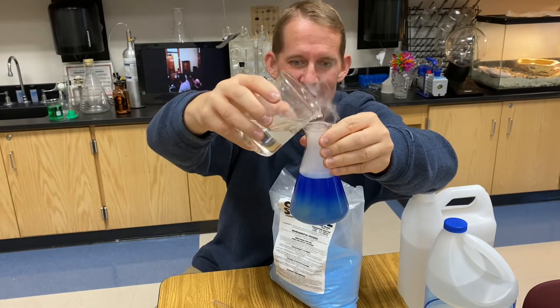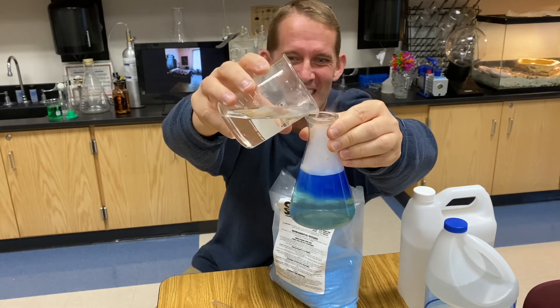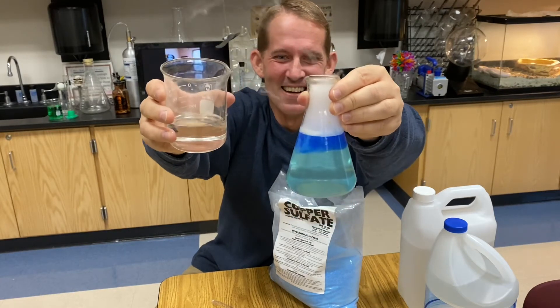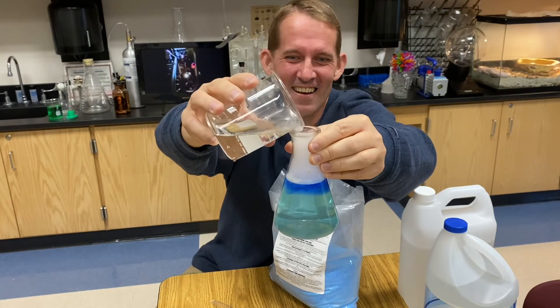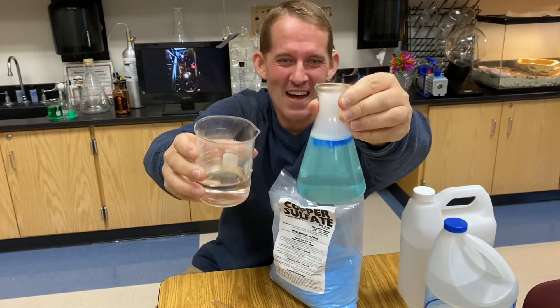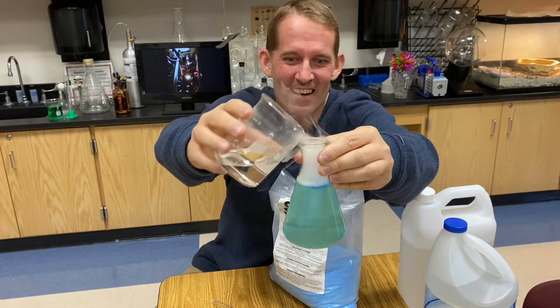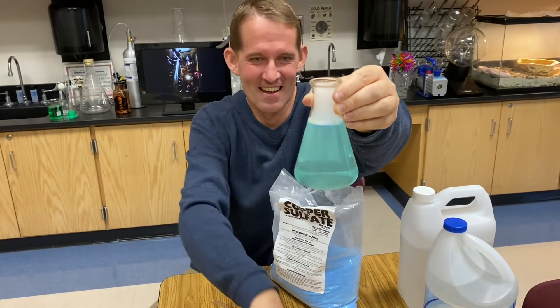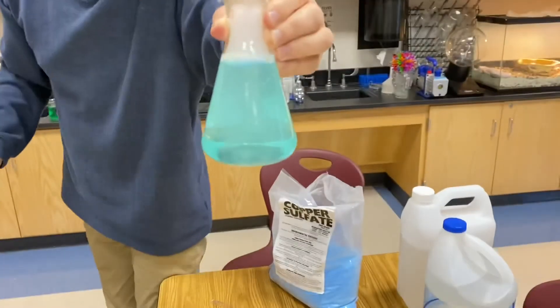I'm going to use hydrochloric acid and slowly add it to my solution. Watch what happens — watch the blue change. Isn't that amazing? It's almost back. And suddenly, I am back where I started!